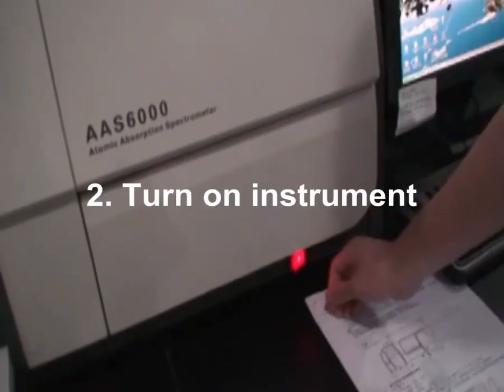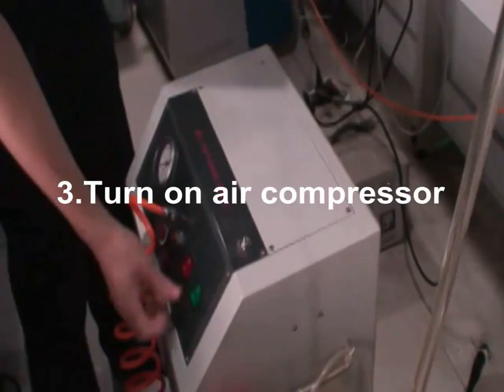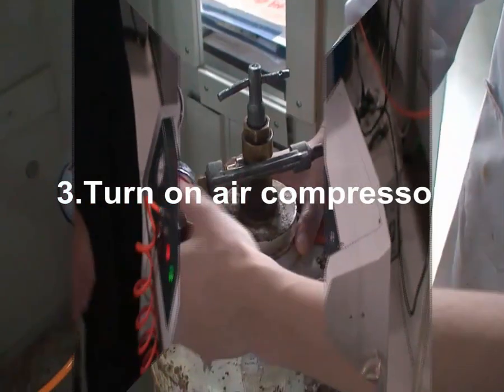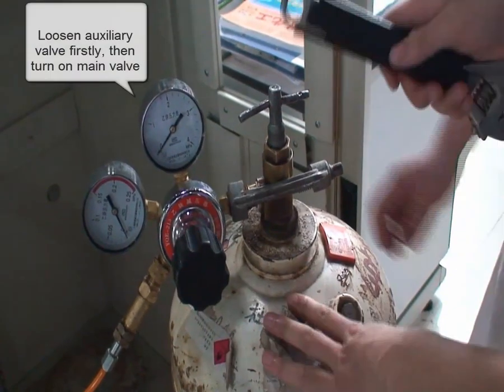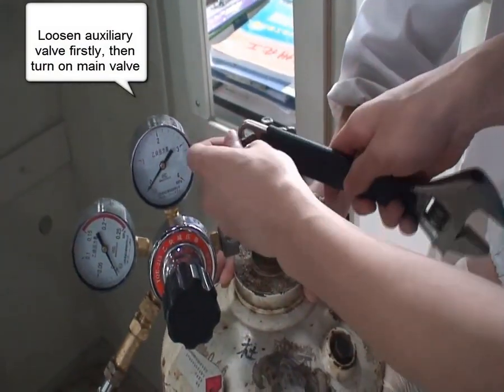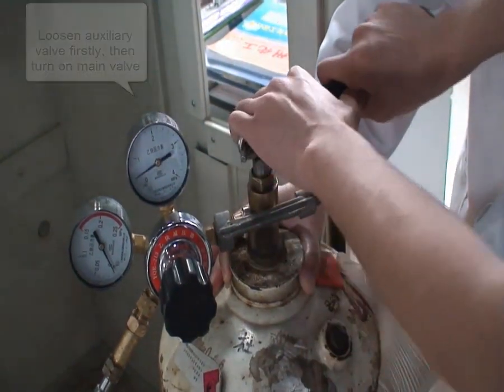Second, power on the instrument. Third, turn on the air compressor. Fourth, turn on the acetylene cylinder. Loosen the auxiliary valve first, then turn on the main valve.